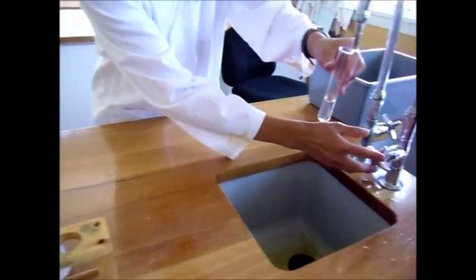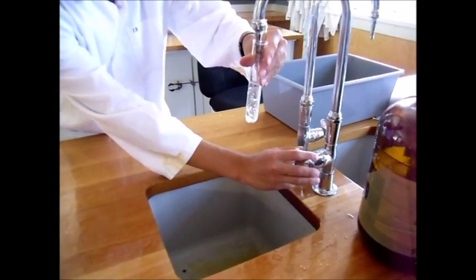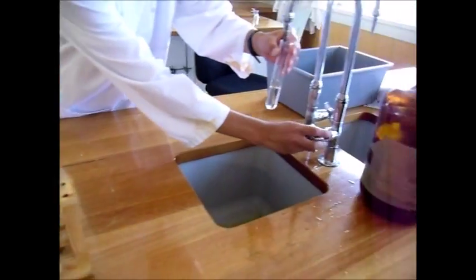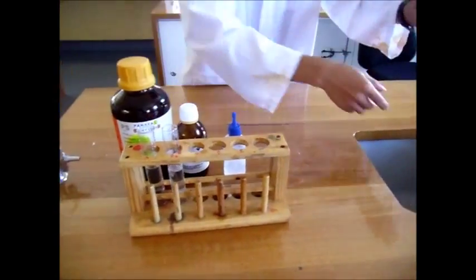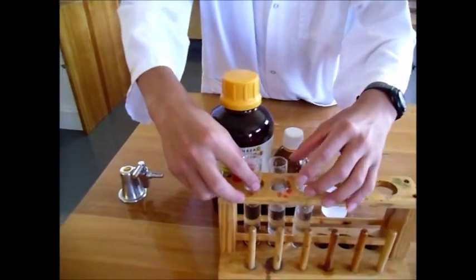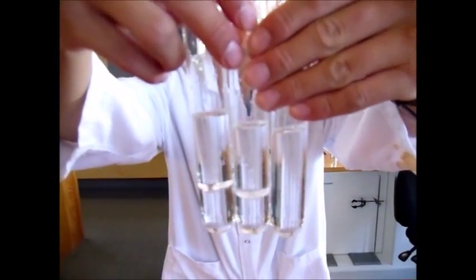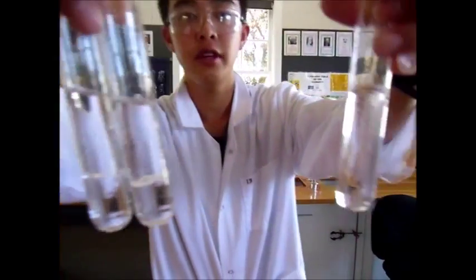So, we will add some water to each of these. Although it is not particularly clear, you can tell that the alkane and alkene are not soluble in water, as layers form, whereas alcohol is soluble in water.